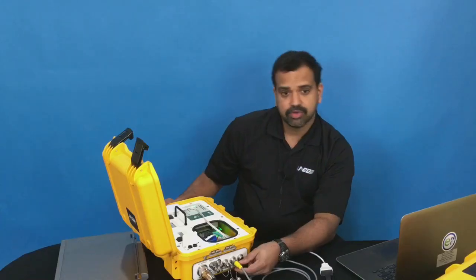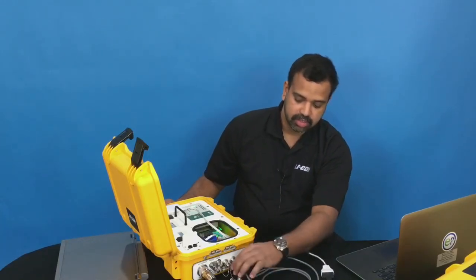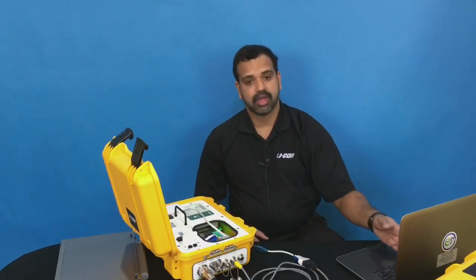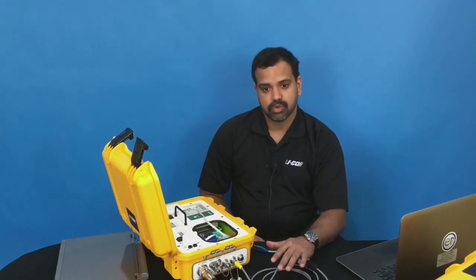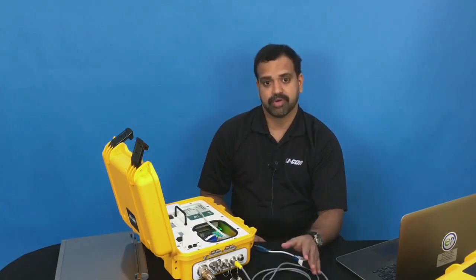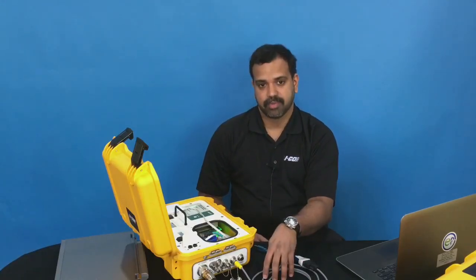The third way to do this data transfer will be to use an RS-232 connection. So you can see I have an RS-232 cable attached to a USB to serial adapter which I can hook to my computer and transfer the data. This is a really slow process, so if you're doing data transfer in the field, you always use the network transfer or the direct transfer where you use a card reader or a card reader built into the computer.